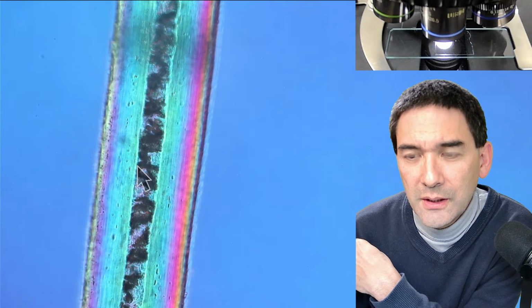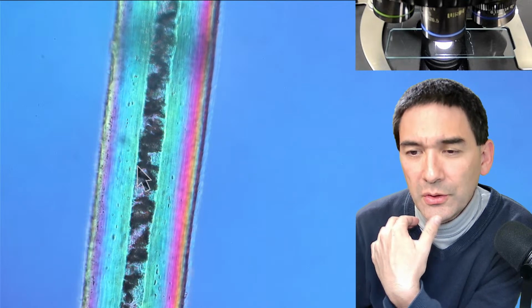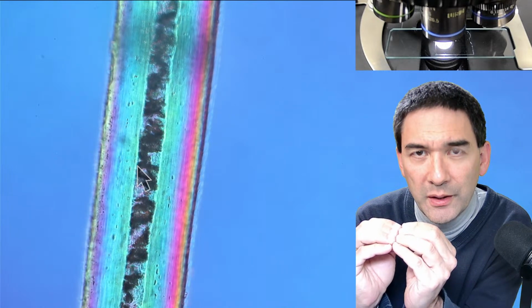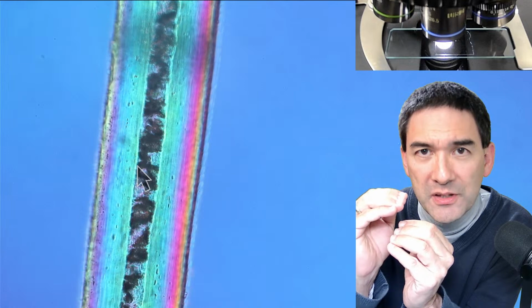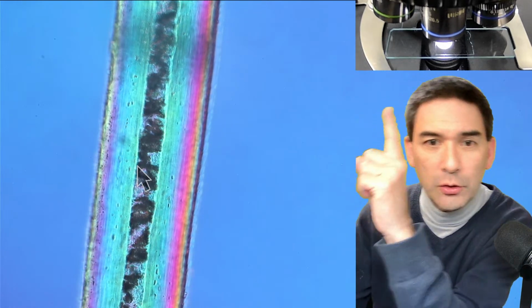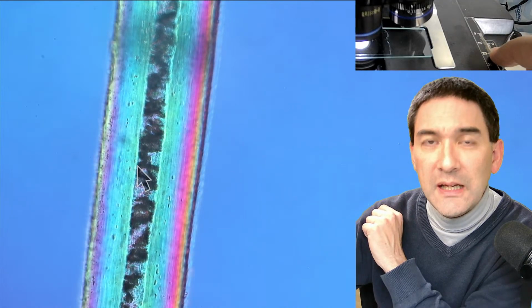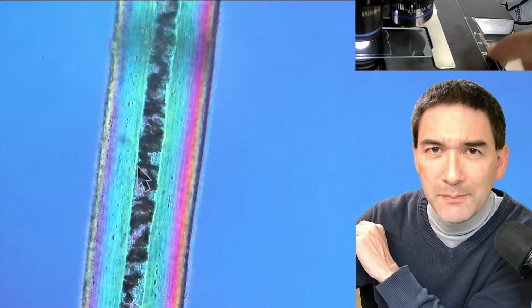Is it possible to take measurements using the cross table? So the question, I think, I don't know what you mean with cross table, but maybe you're referring to the stage micrometer, the scale that you have on the microscope stage. Maybe that is the thing that you're referring to. I'm going to show you just a second. Maybe you're referring to this scale over here. Right?